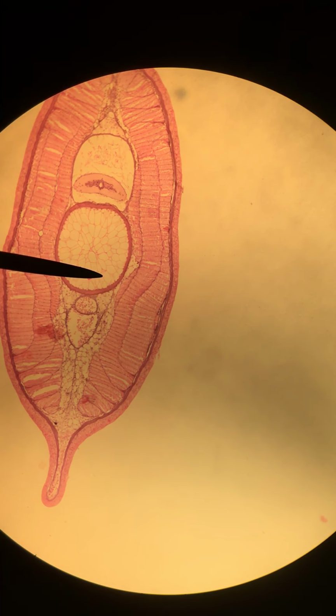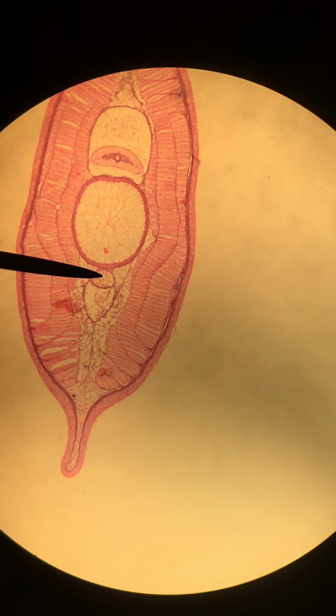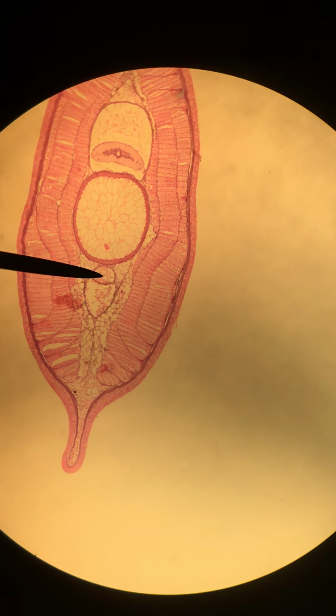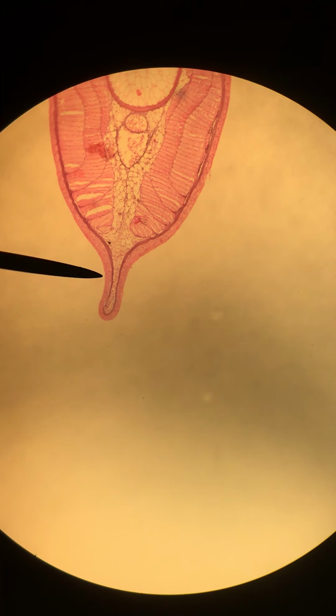Now on the midline, the dorsal aorta has become the caudal artery. That's what the pointer is on now. The caudal artery is a continuation of the dorsal aorta. Just ventral to that is our caudal vein. This is returning blood back to the heart, whereas the artery was taking blood away from the heart. I will also mention the caudal fin.